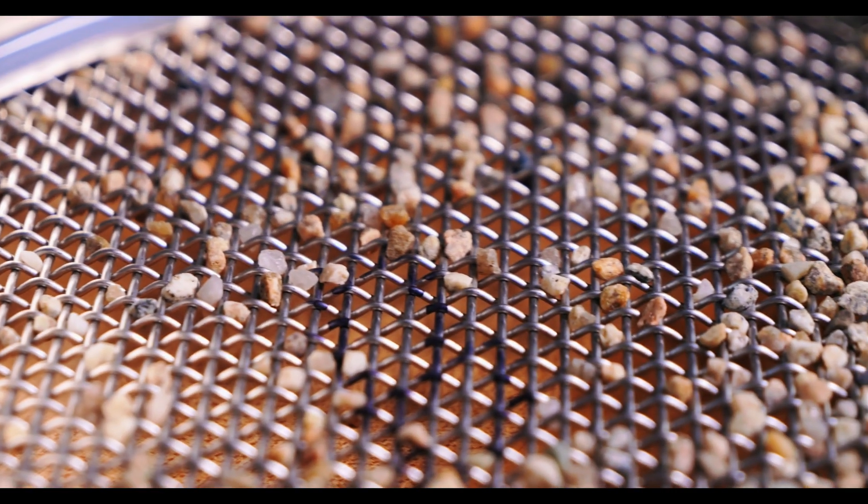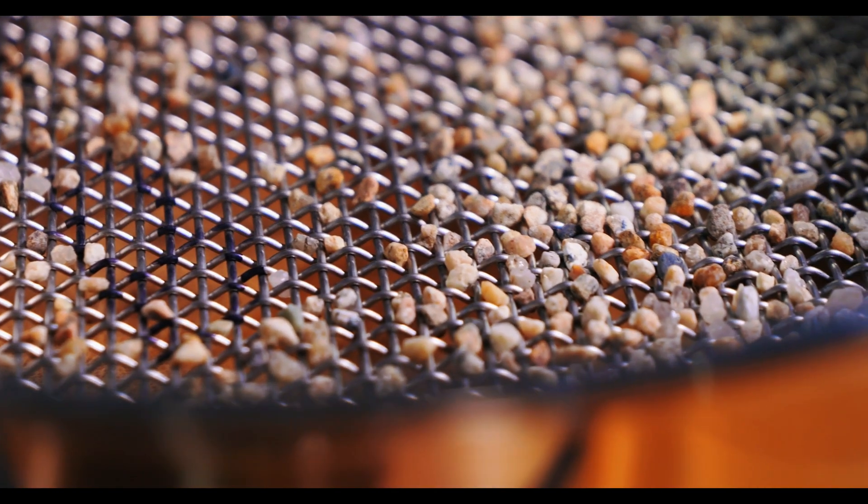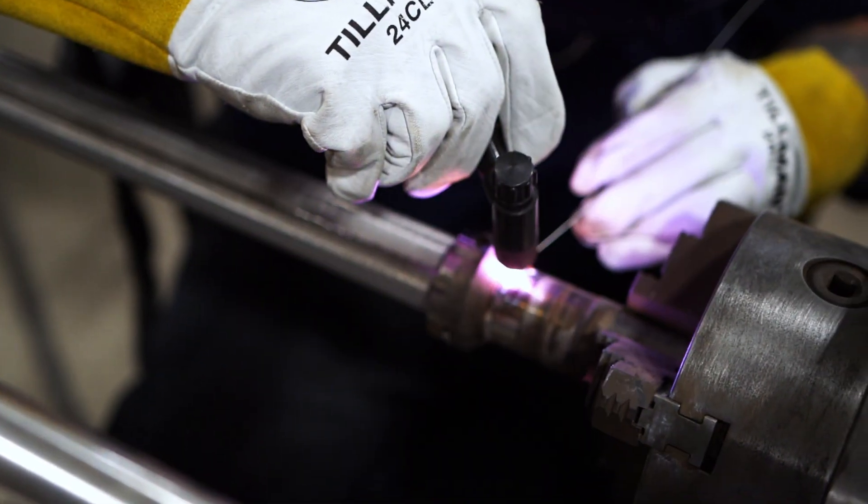There are a few cleaning methods that could damage your sieve. Using an oven to dry your test sieves or a dishwasher to clean them can be very harsh on most mesh counts. Air pressure can also be a detriment, since the pressure can warp the mesh. Attempting to dislodge particles by hand usually ends with the mesh being scratched or dented. Acidic solutions should also be avoided since they can corrode the mesh. And since woven wire mesh is an incredibly precise product, attempts at repairing the mesh through welding or other means will only damage its accuracy and integrity further.